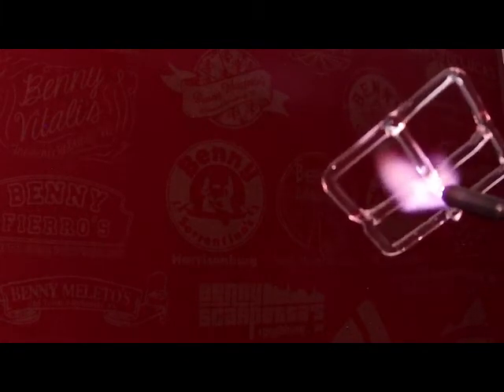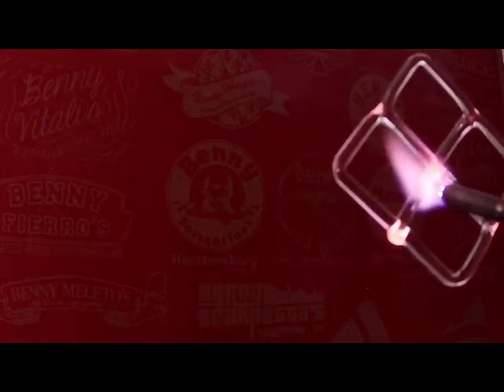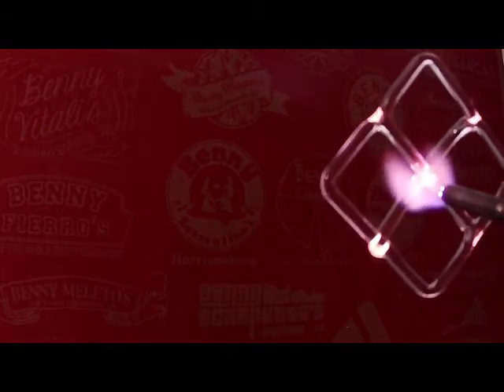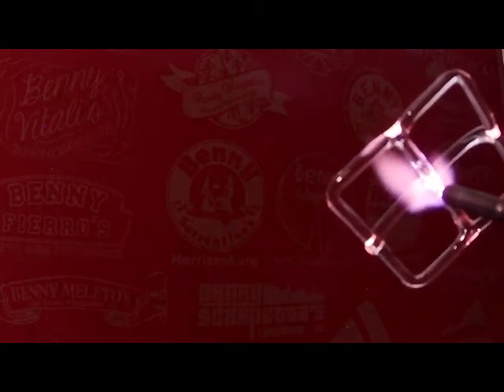So what are we looking for when we're welding two pieces of glass? The most obvious answer is, well, we don't want two pieces of glass, right? We don't want two glass rods. We want one glass rod. So what I need to do is get all of this glass right in this center area heated uniformly, heated to working temperature, so that they flow together. And instead of having two glass rods that are in contact, I now have one glass rod that is fused in that spot.